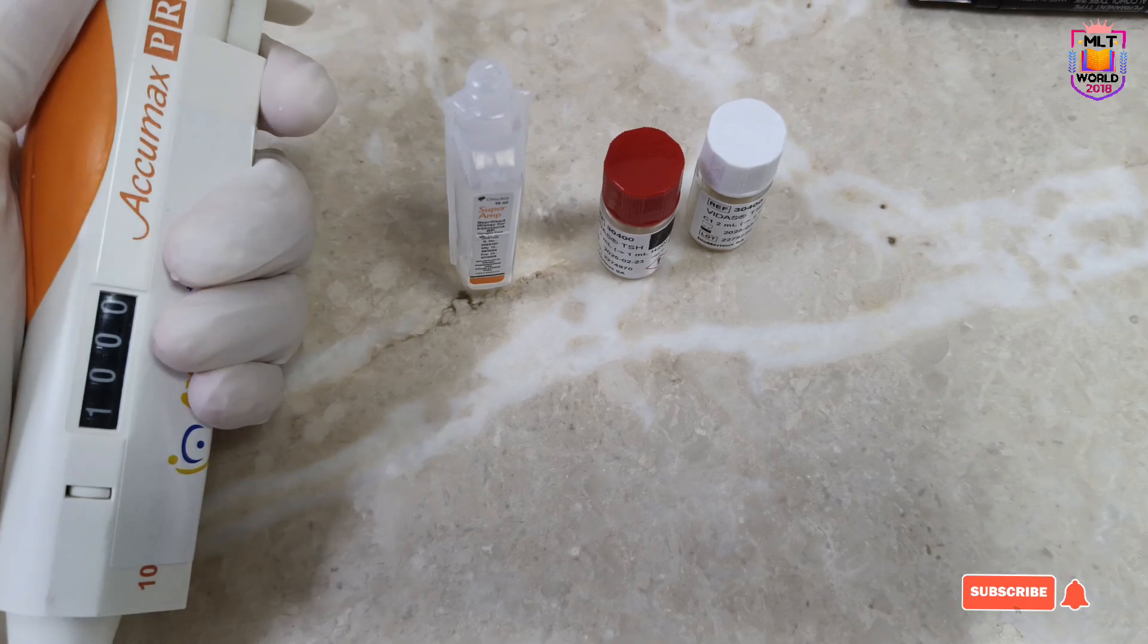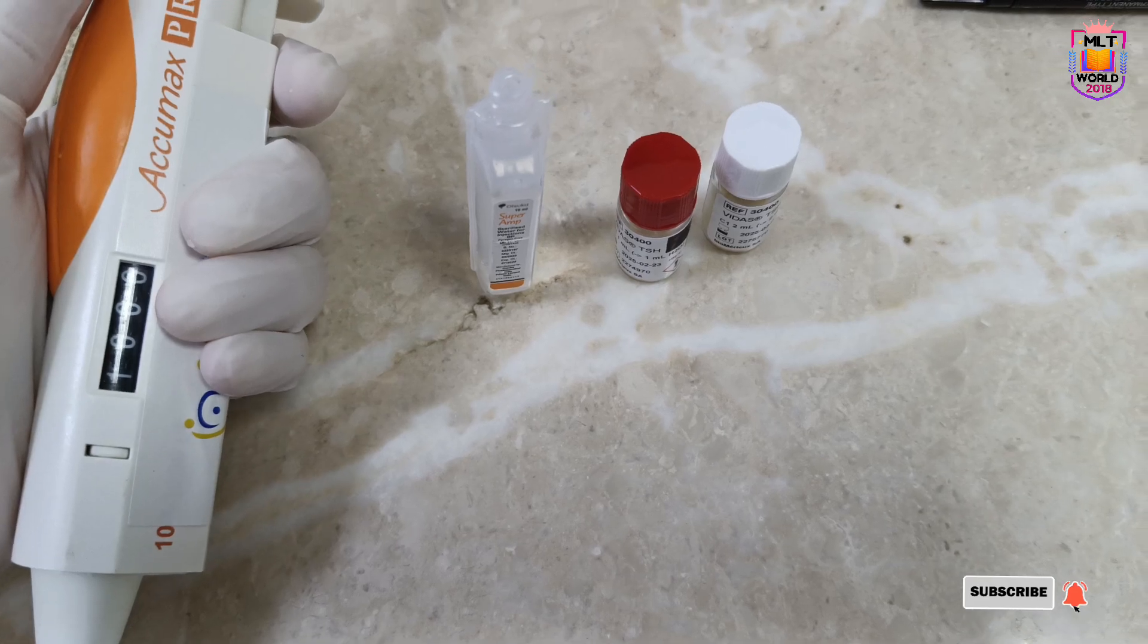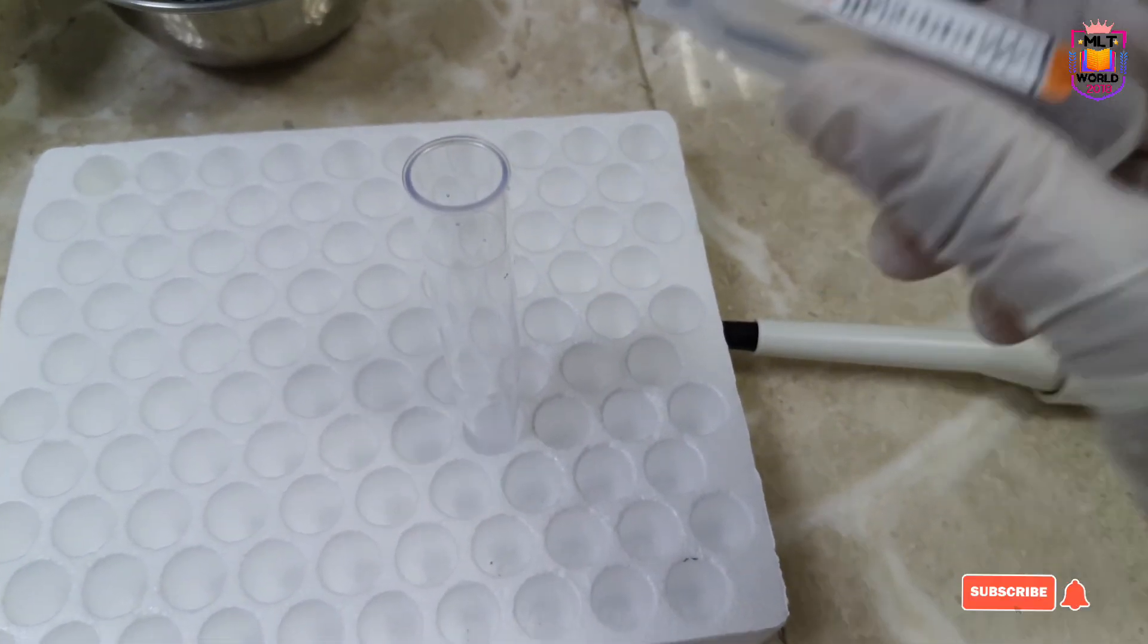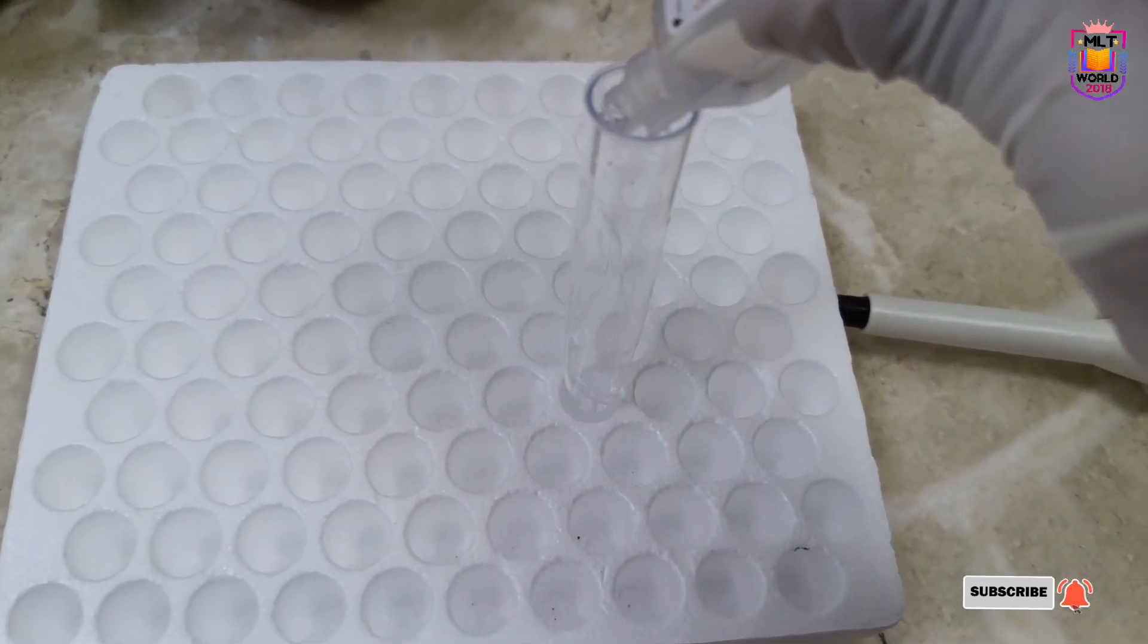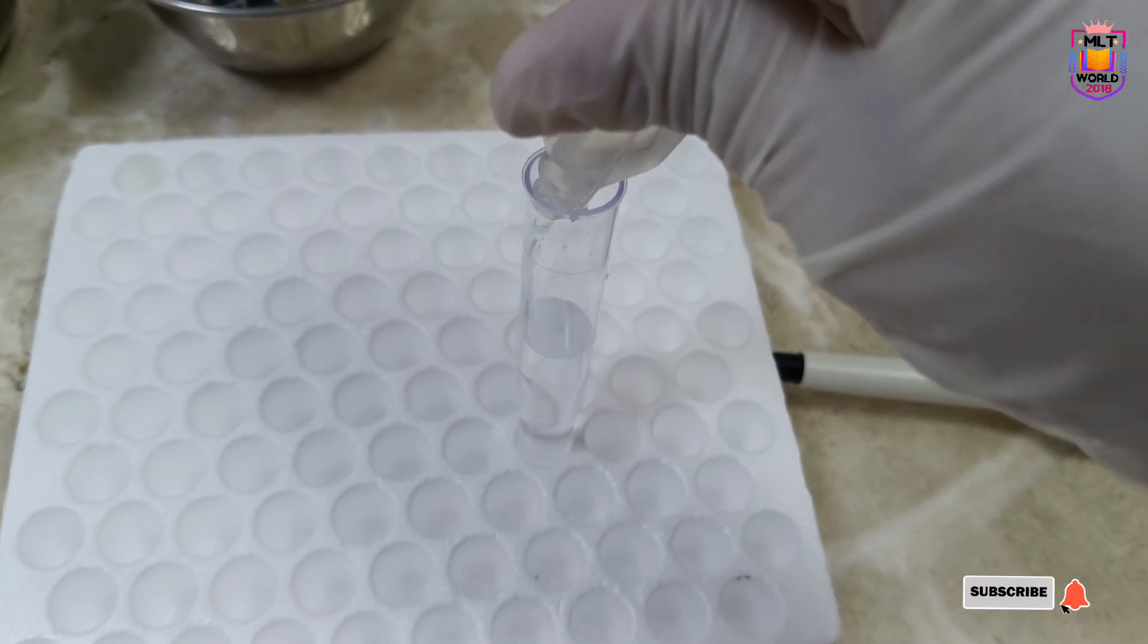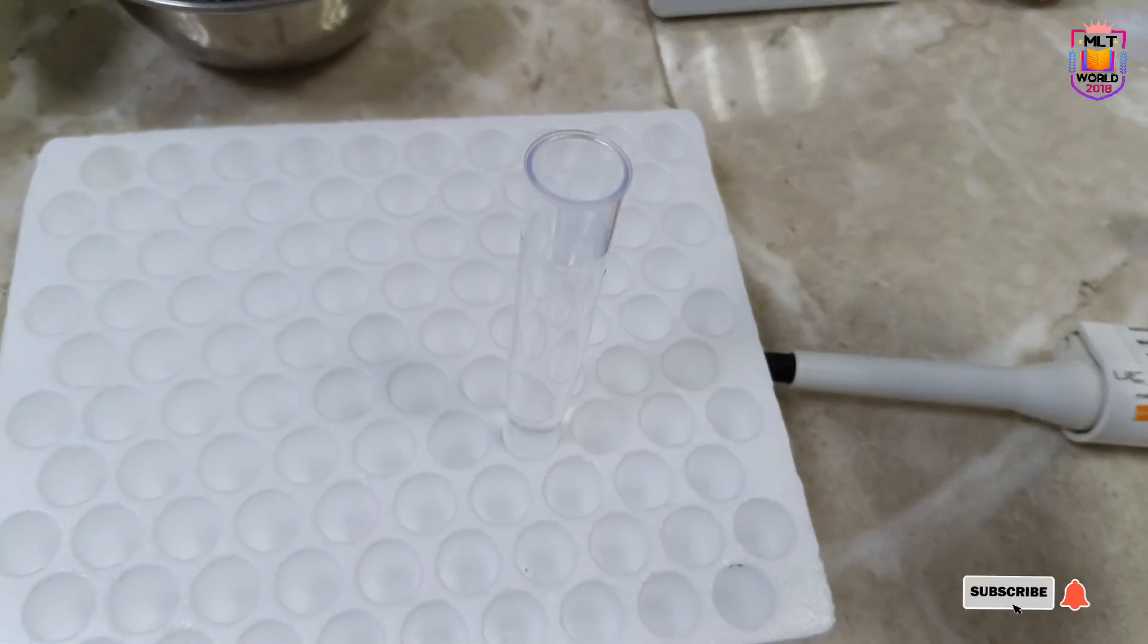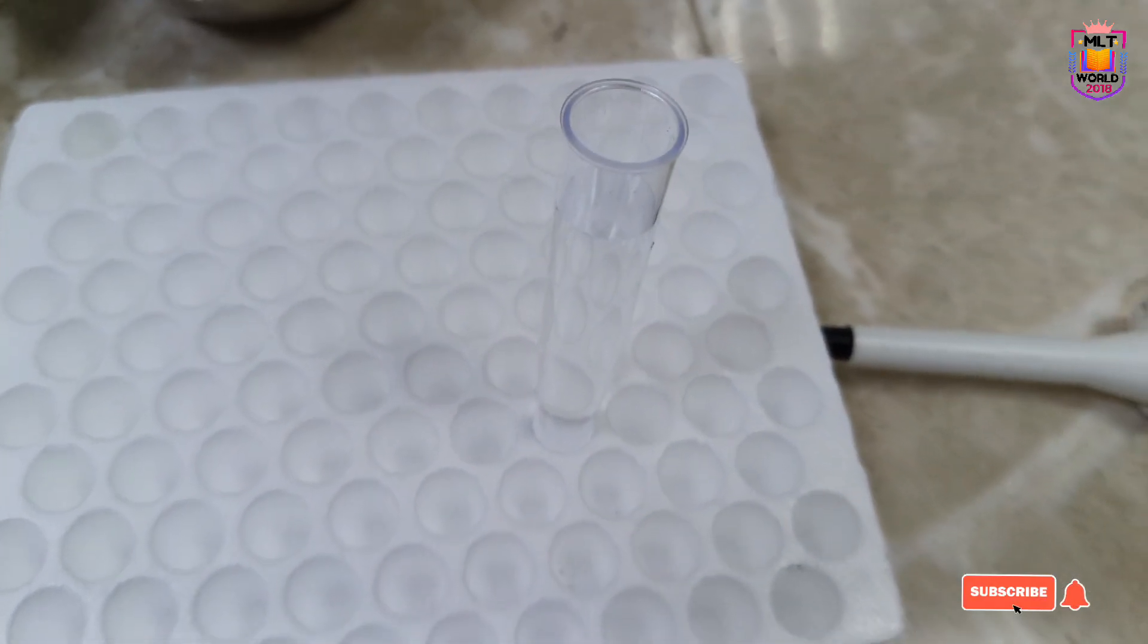If you have any other tube, you can dispense into that also. Just for correct pipetting we need a proper container. We need the proper container for accurate measurement.